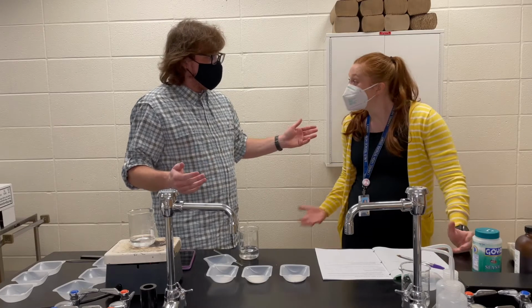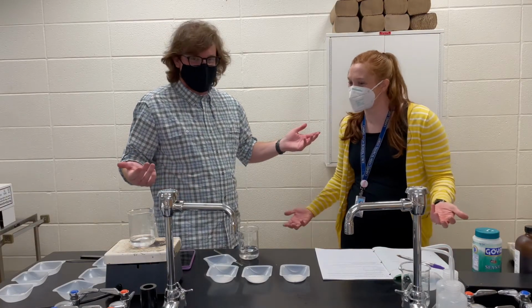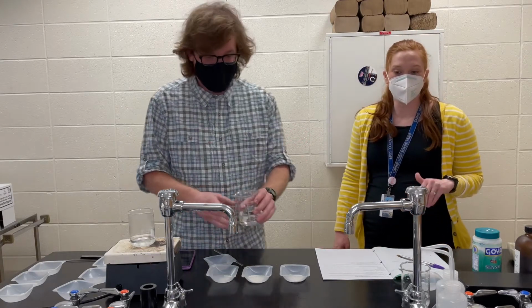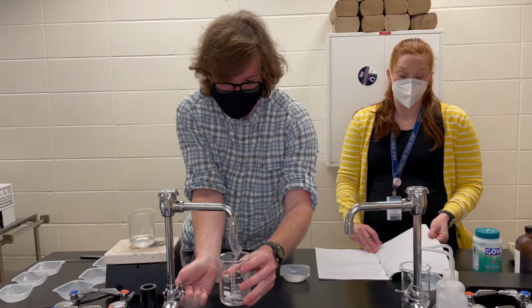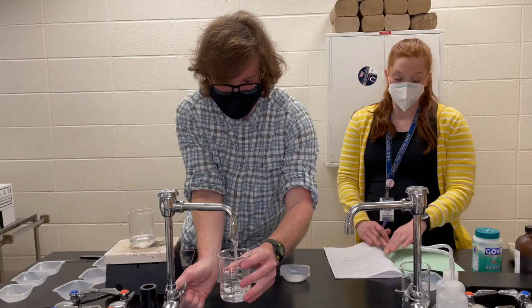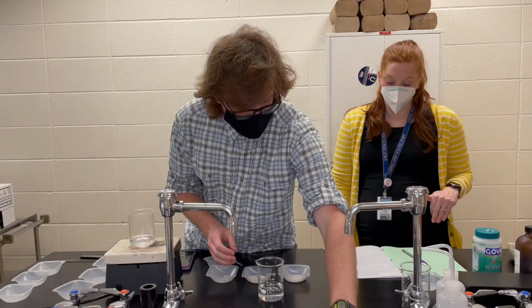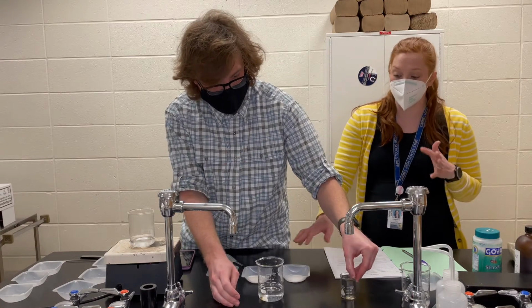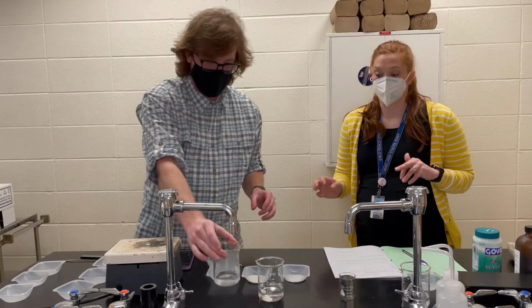Let's get started with part 1. That's where we started. That's the best place to start, always and forever. So we're gonna look at the effect of temperature on solubility rate. We've got samples of salt already measured out, 0.25 grams. We've got just a normal size salt crystal, in the medium size of the 3 that we have. But what we do have are 3 different temperatures of water.